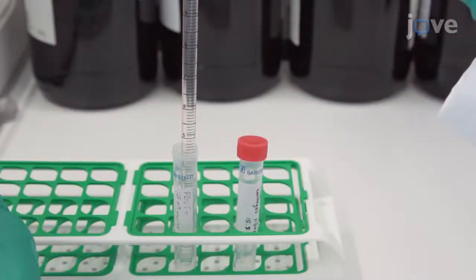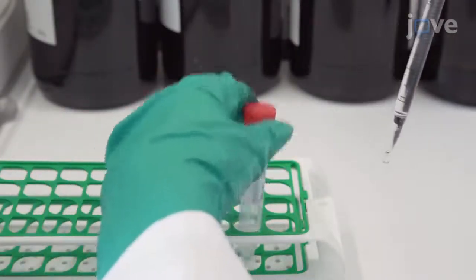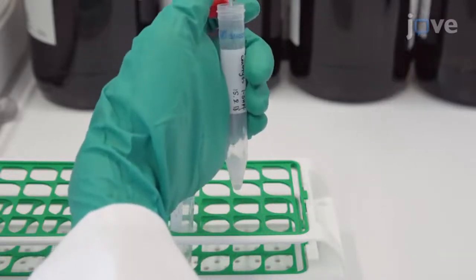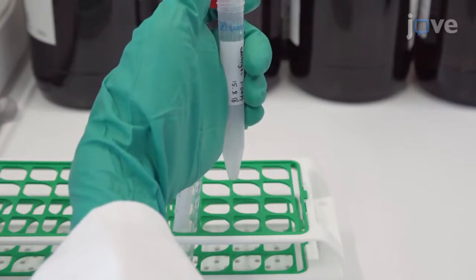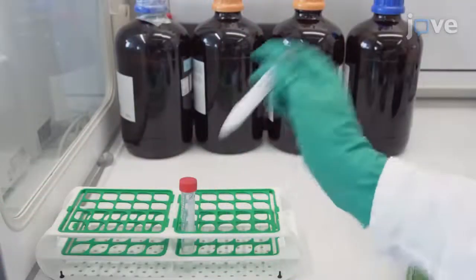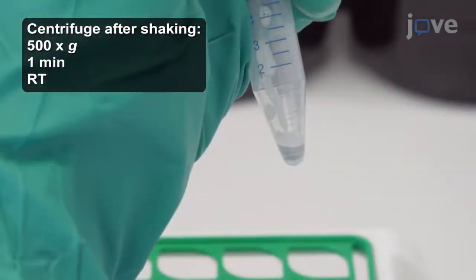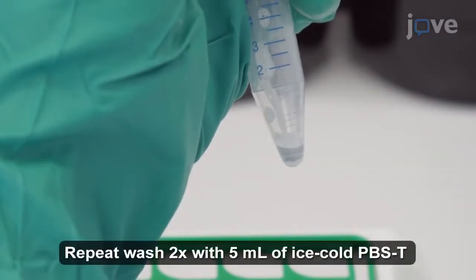15 minutes after the addition of formaldehyde, resuspend the embryos in 5 milliliters of PBST with 125 millimolar glycine. Shake the embryos up and down vigorously for 1 minute. After centrifuging, aspirate the supernatant.